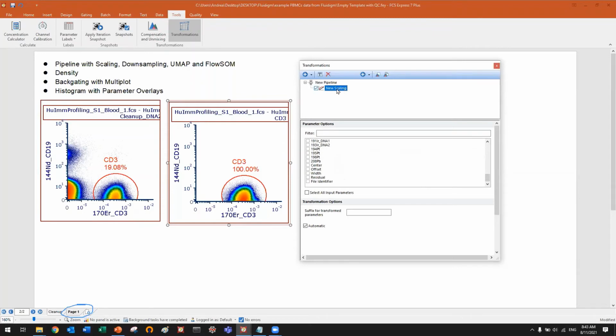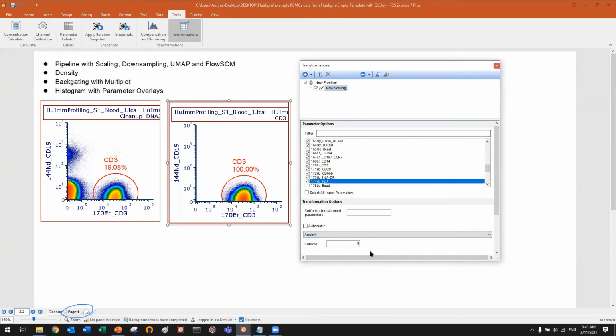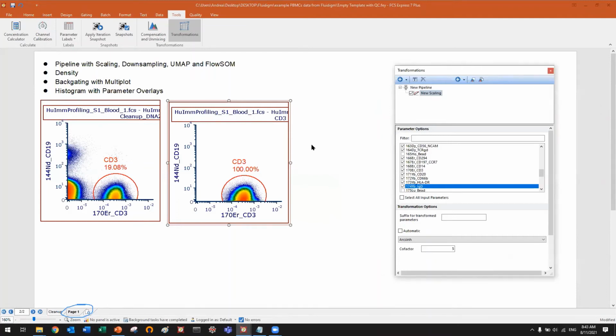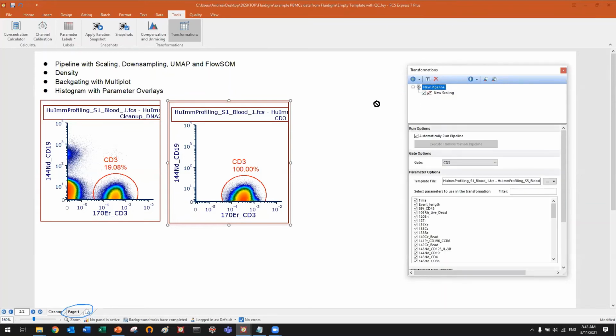What this step is doing is scaling. So how do we want to scale? Let's say that we want to use the arcsinh, the very well-known arcsinh transformation. We could probably spend half an hour on scaling, but of course we have no time today. If you have any question, any doubt, feel free to reach us, because high-dimensional data analysis is a huge world. This is why I want to do something very quick and simple today. This is the first step: we are scaling the selected parameters. And I already want to show you that if I apply the pipeline now, this pipeline is just scaling. It's not doing any t-SNE, any UMAP.